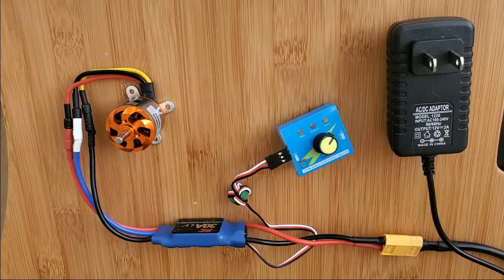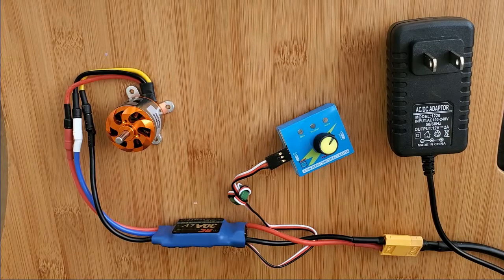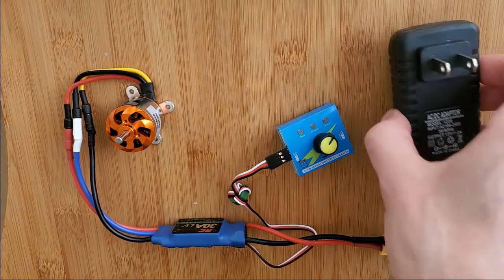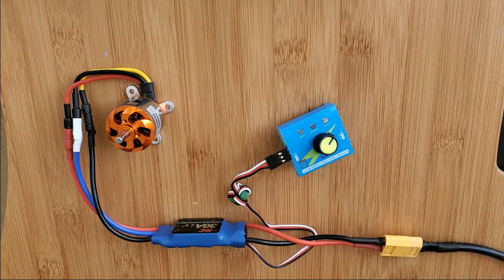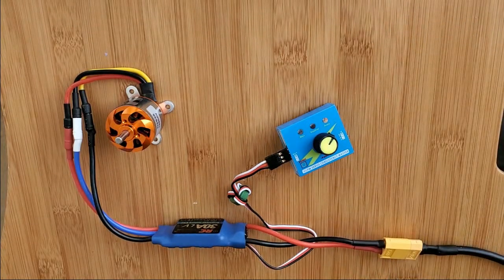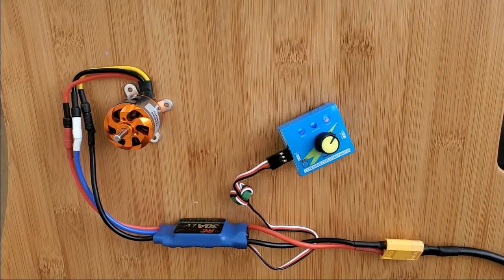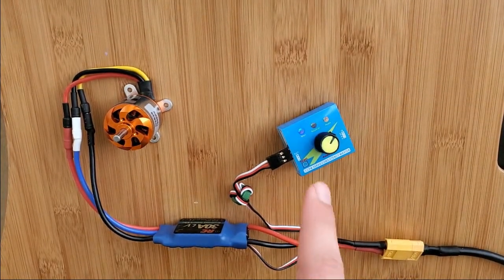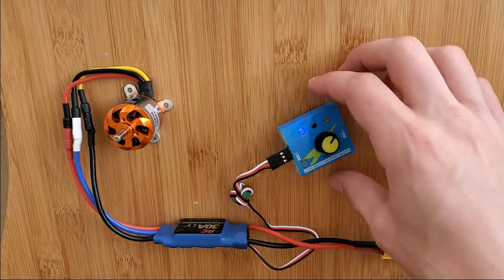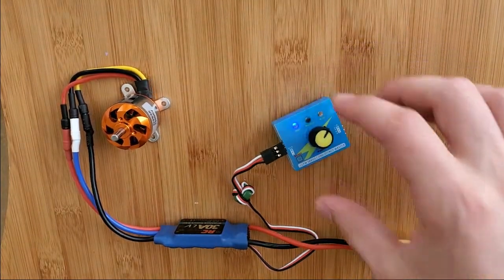The operation of this setup is really pretty simple. When I plug in the power supply, you'll see the servo tester goes through a bit of a boot load-up sequence.